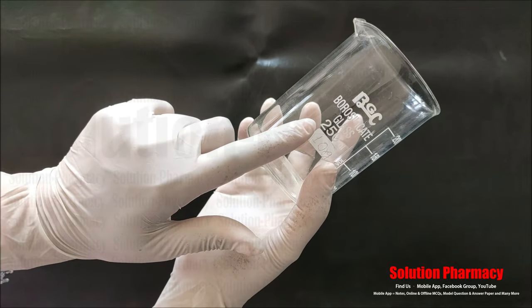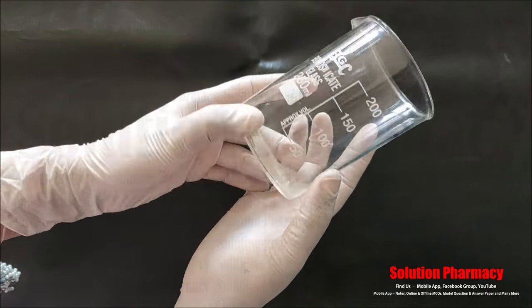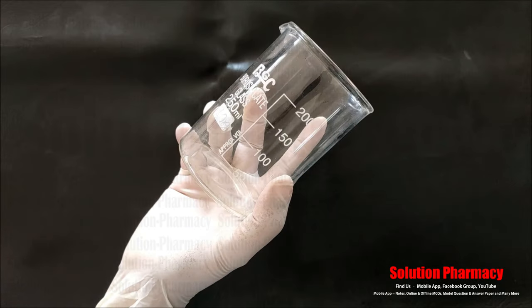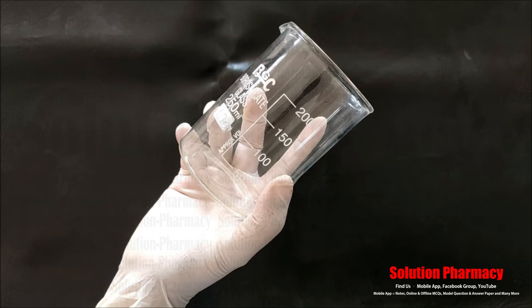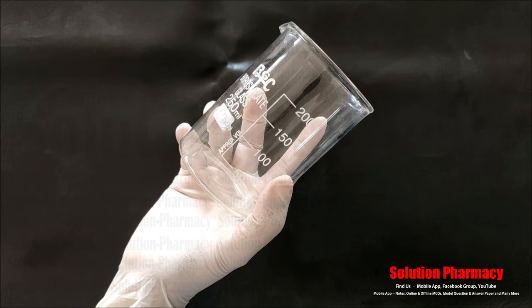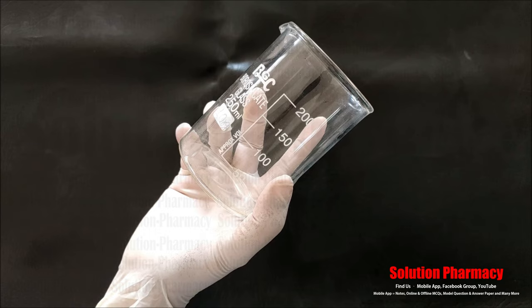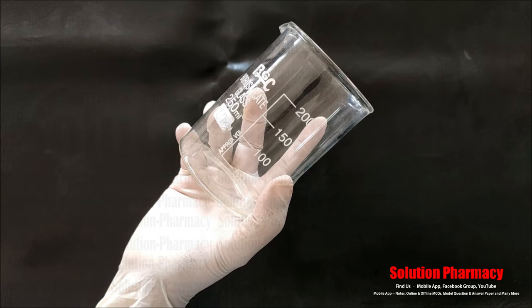This beaker is made of borosilicate glass. Any glassware made of borosilicate glass can withstand high temperatures — it will not break. Borosilicate glass can handle temperatures between 350–400 degrees, so if we have to boil some liquid we will use a beaker made of borosilicate glass. If we use a normal glass beaker which is not borosilicate — means simple soda lime glass — we should not use it for high heat.